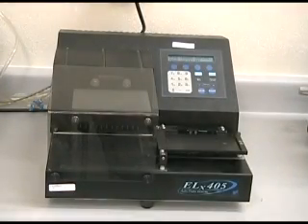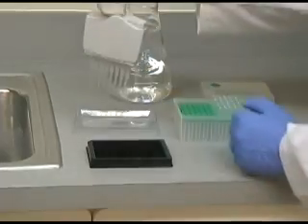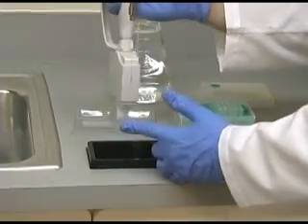There are two methods for washing the plate that have been found effective: using an automatic plate washer and using a multi-channel pipetter. Both methods will be demonstrated here.